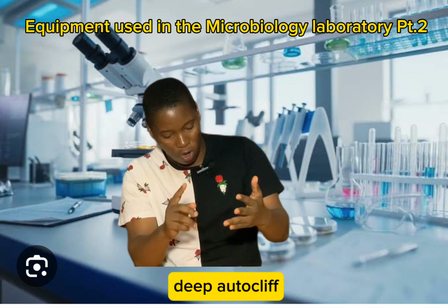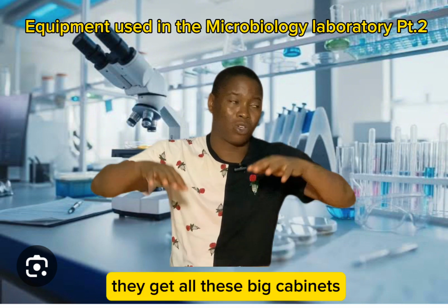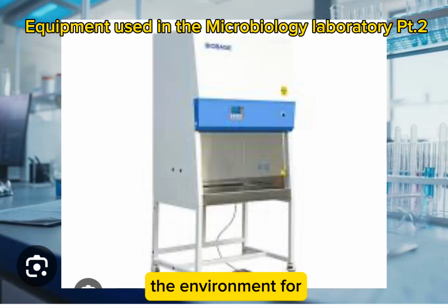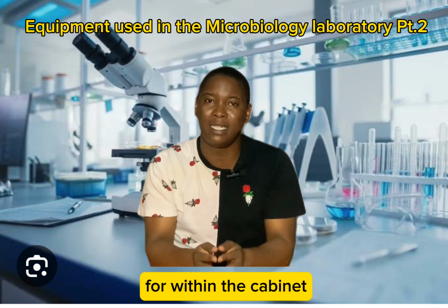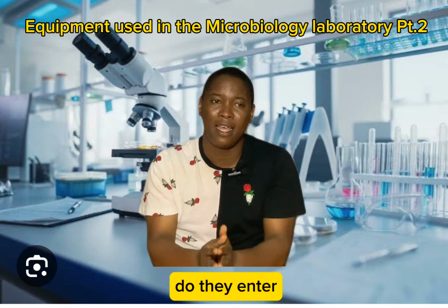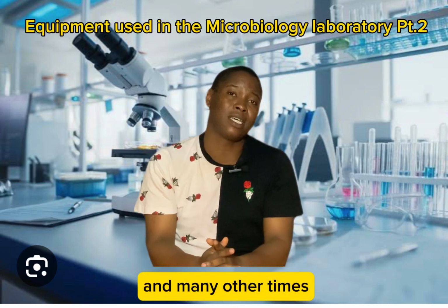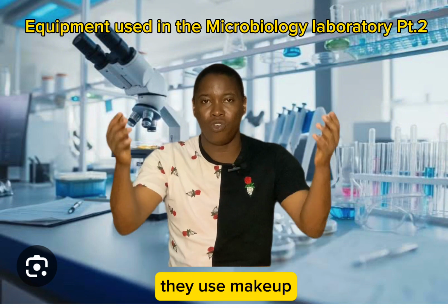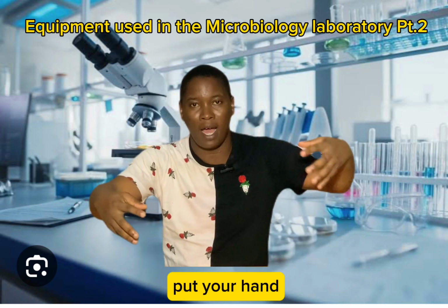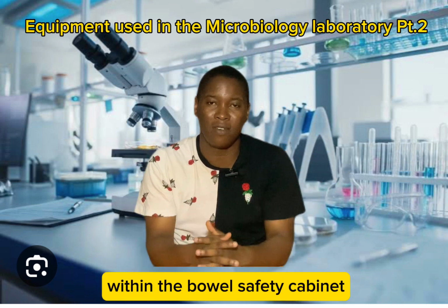So incubator dey, autoclave dey. The next one na biosafety cabinet. Many big laboratories dey get all these big cabinets, and these cabinets dem be cabinets wey be say the environment for within the cabinet dey controlled. We no want any kind of microbial contaminants to dey enter that cabinet. So we'll get big cabinet like that. Many big laboratories dey get them, and many at times many of these cabinets na glass they use make am, and many of them too go dey wey be say they go get places where you fit put your hand, they run all the different experiments wey you wan do within the biosafety cabinet.